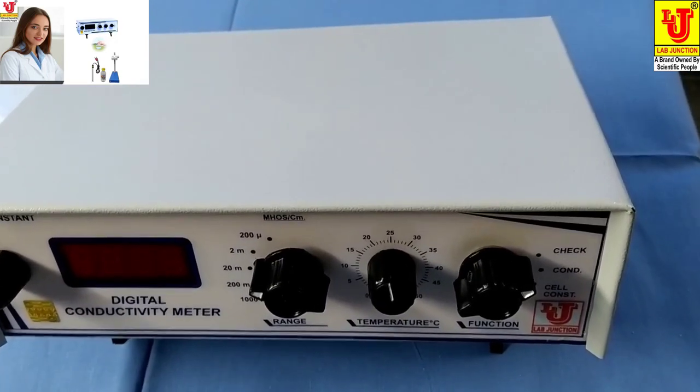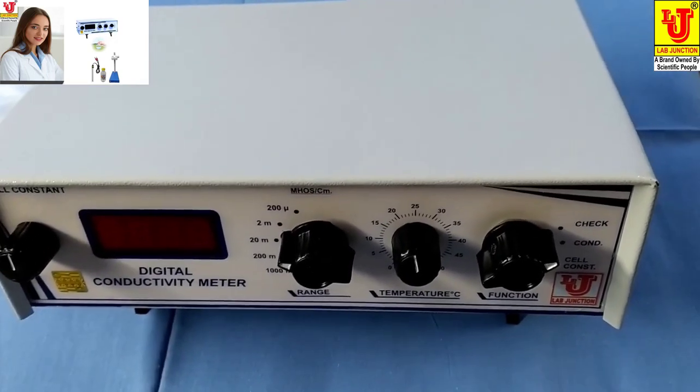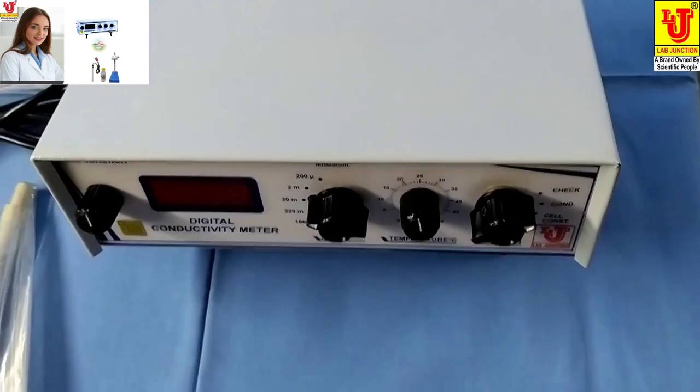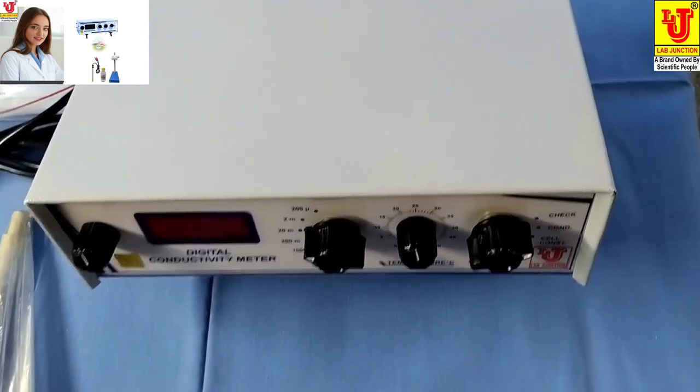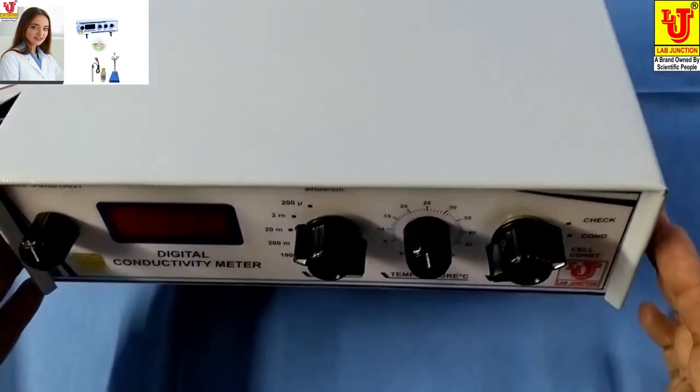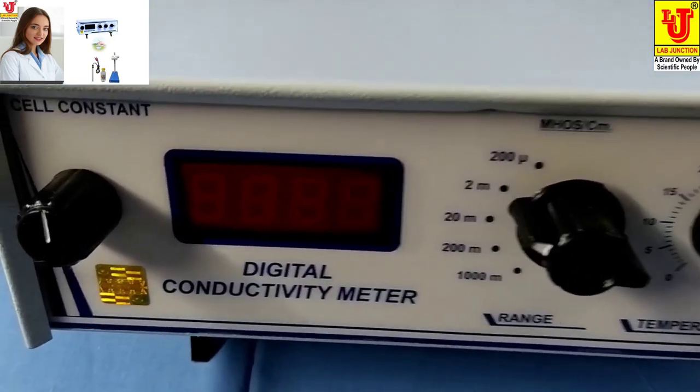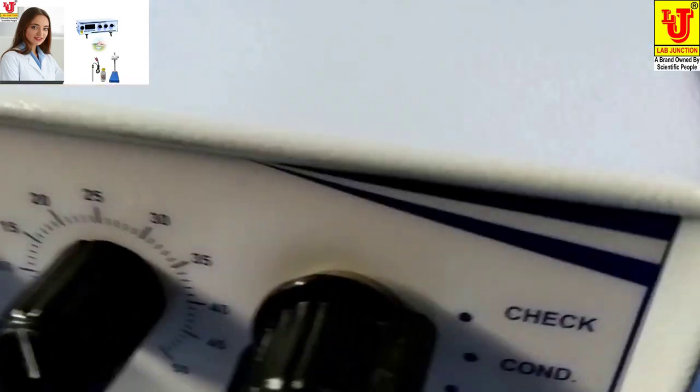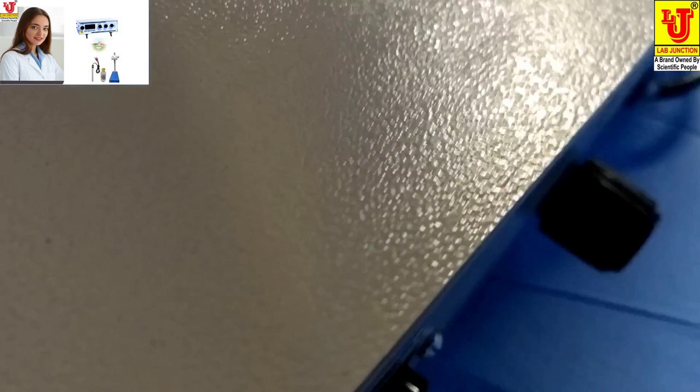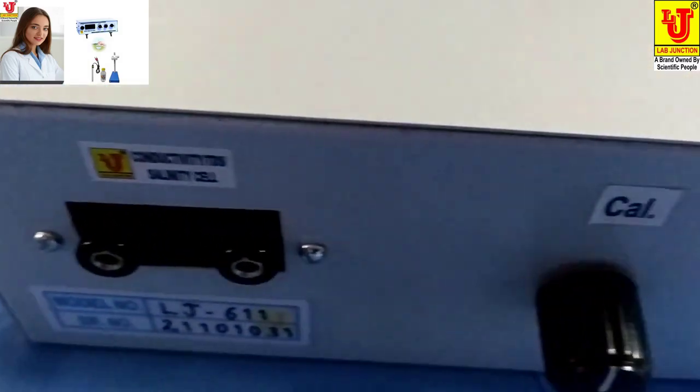Now how to use Digital Conductivity Meter. This is our main machine of Digital Conductivity Meter. This is the front view, side views, back views, again side view.